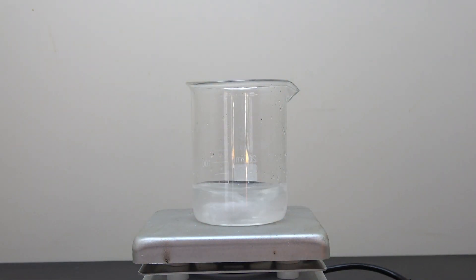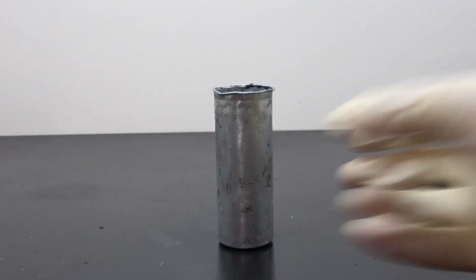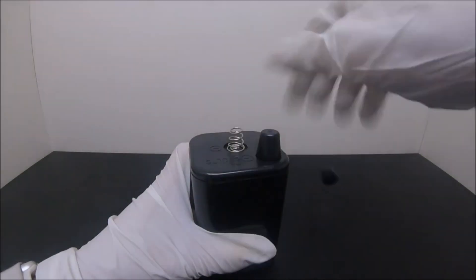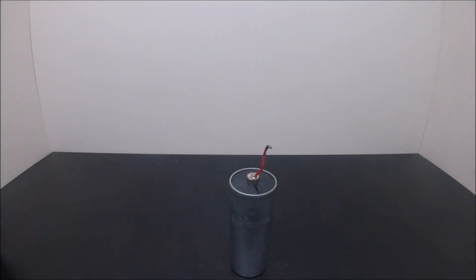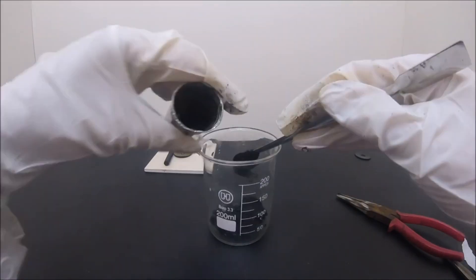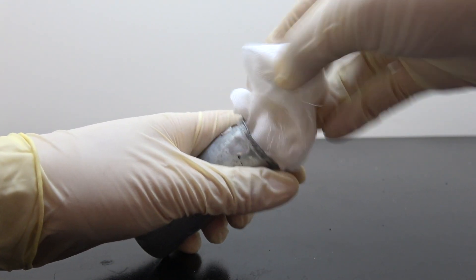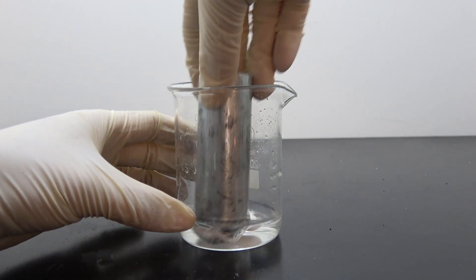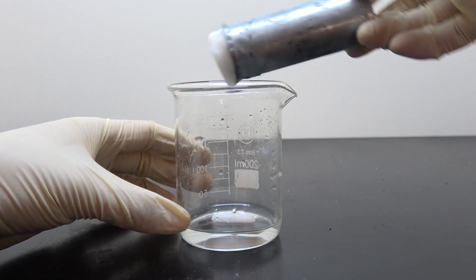Just to be clear, I am aware that in conventional zinc plating the metal to be plated is fully submerged in the zinc sulfate solution, and 40 ml of solution seems a little too good to be true. Luckily there is a trick — all we need is one of those fellows. It was from a project so old that I myself almost forgot doing it. The goal of that project was only to get manganese dioxide from those cells, but it comes in handy after all those years. It's perfect to not only provide the source of zinc for the zinc plating, but also act as a container for the electrolyte. With the help of some bandage to soak up the zinc sulfate solution, our makeshift zinc plating device is officially complete.